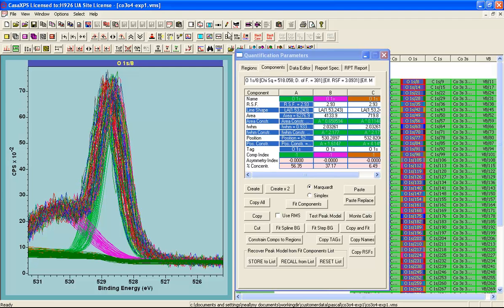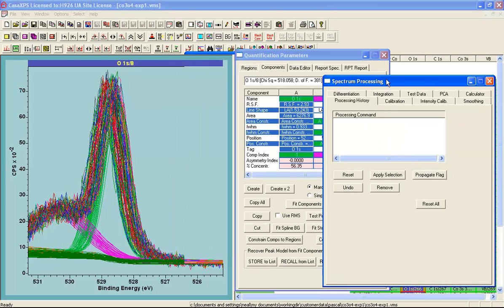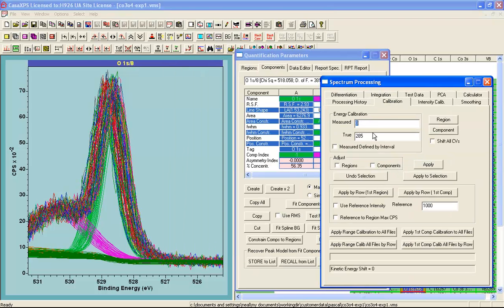And what I need to do is then use the spectrum processing dialog window, the calibration property page. I need to specify an energy. So I've specified 530 eV binding energy. And what we'll do is shift all of these data in each row using the difference between the position for the first component on the property page we see here and the value that I've entered for the true value. Let me just tick the region and component adjust buttons so these will also be adjusted as part of this operation.